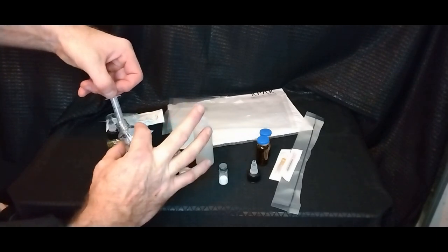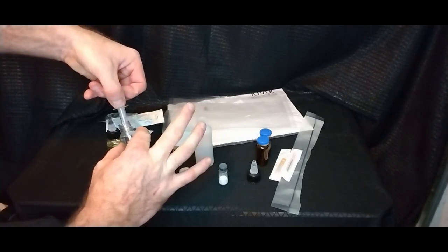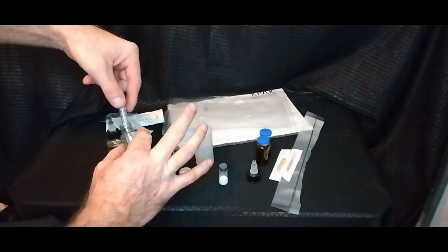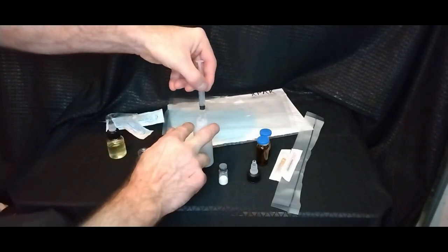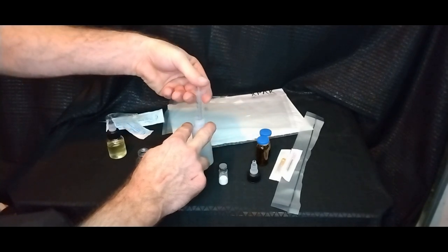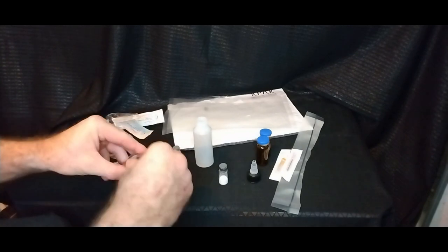So we want to keep that on the low side. So instead of, okay, so we're going 10. So I'm just going to go for now. And this is a lot, but what this is, is this is not all benzyl alcohol. This is a mix of things. And we're just going to start with one milliliter and we're going to see how that goes first.